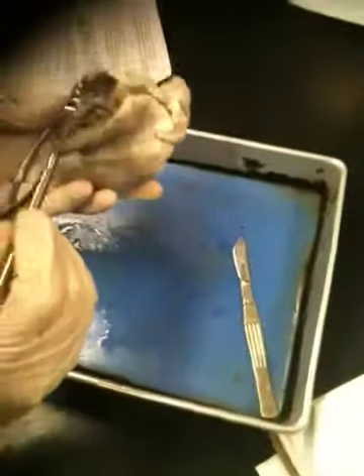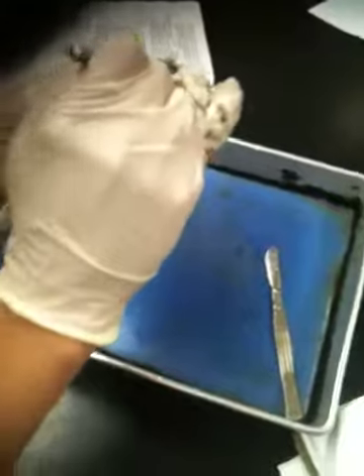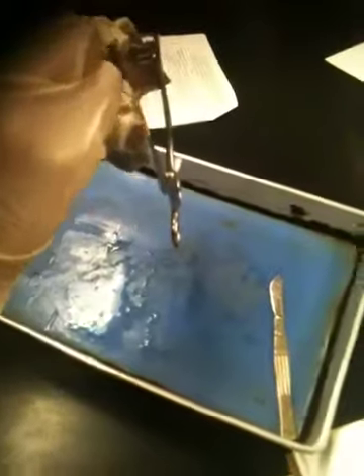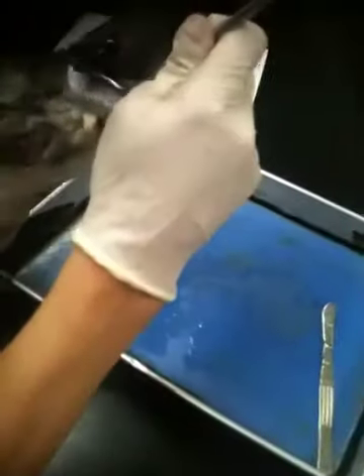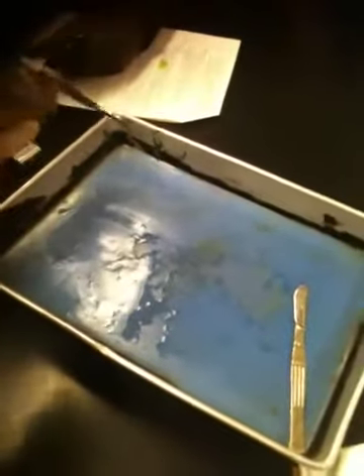The valve itself are the white flaps of tissue that the strings are attached to at the top. So for example, what if I pointed up here and I said name the chamber you're in? You're now in the right atrium, and you can tell because now you are superior to all of the valve. If the valve is these white flaps of tissue, then up here you are above that valve. So sure enough, up here you are now in the right atrium.